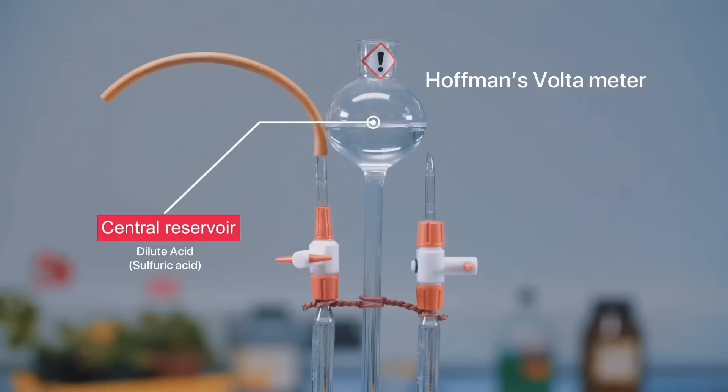In this experiment, we are using dilute sulfuric acid electrolyte reservoir.